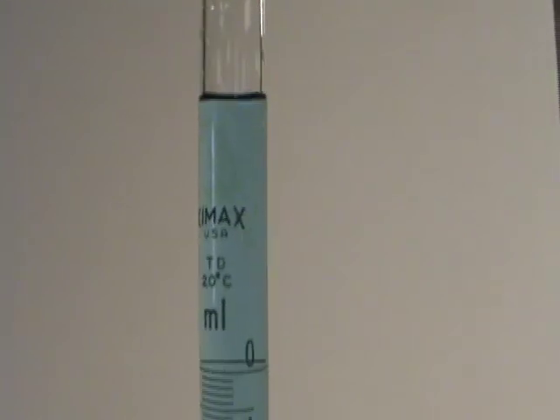There we can see the graduation marks on the burette and our liquid is too high. But I did that on purpose because let's go all the way to the other end.